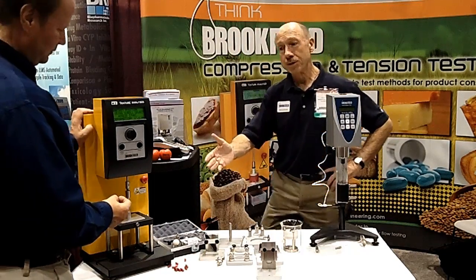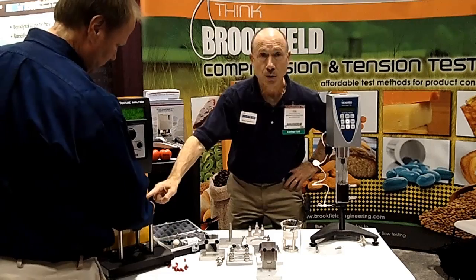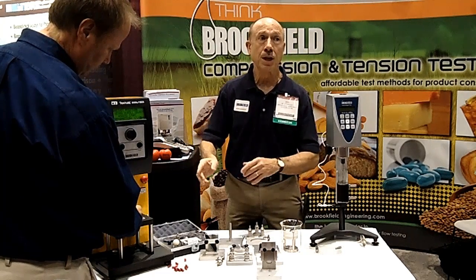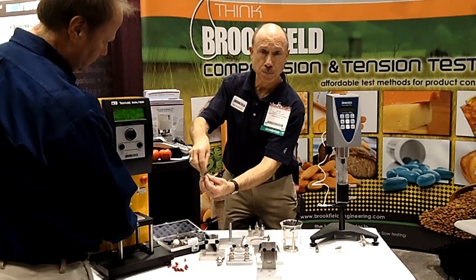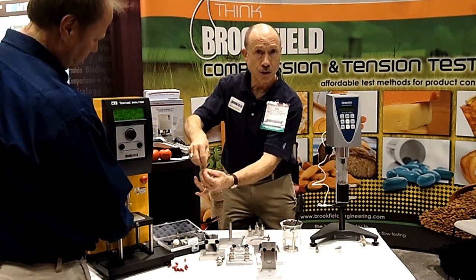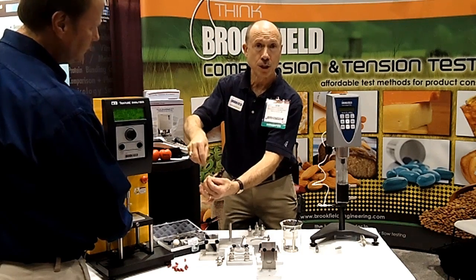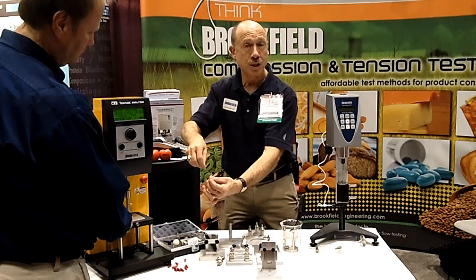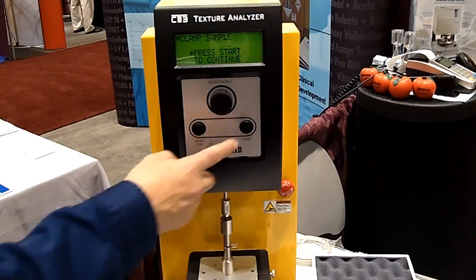Dave is now going to take a half of a capsule and place it on those two tines. Those tines are both attached to cylinders which are going to pull apart at a defined rate. It's a very slow rate, but the objective is to see how the stress builds up in that capsule wall and at what stress level it ultimately fractures and breaks in two.